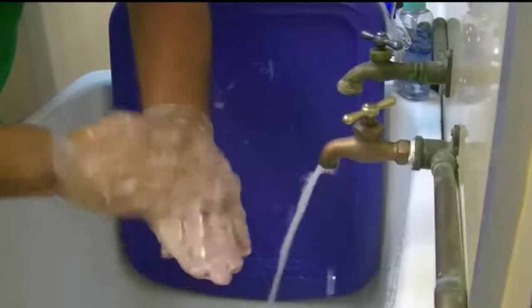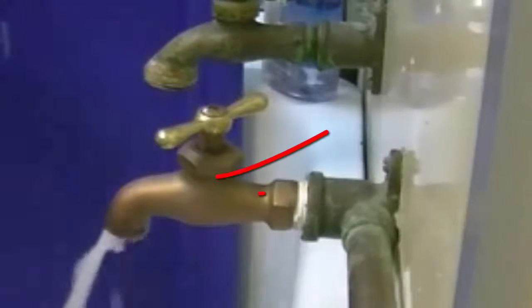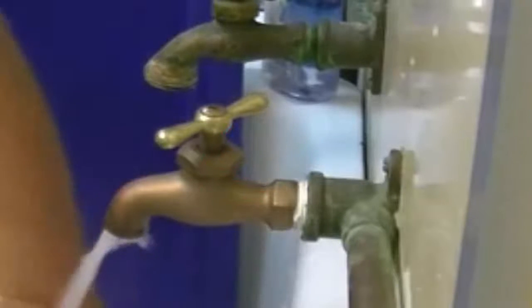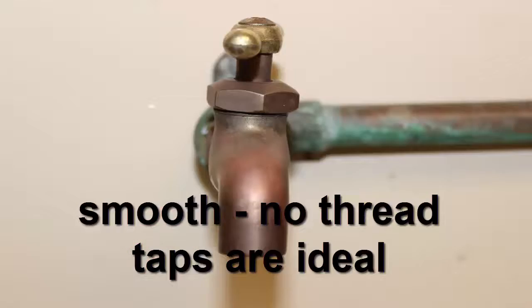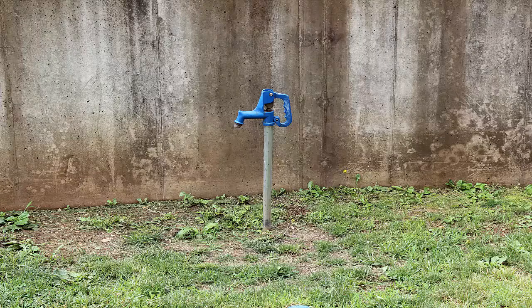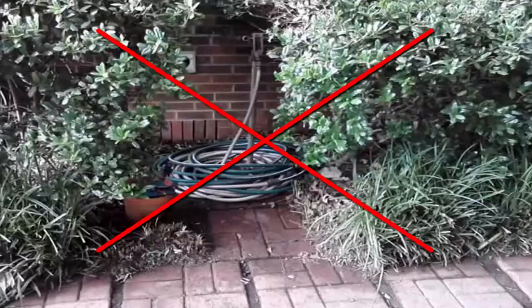Find a good spot for sampling. The most ideal tap or spigot is a cold water only tap with no access to hot water, because bacteria grow more abundantly in warm water environments. You want a tap that lessens the chance of having bacteria. This means you should also avoid vertical frost-free hydrants or yard hydrants, since these have a buried drain hole which can allow bacteria to enter.